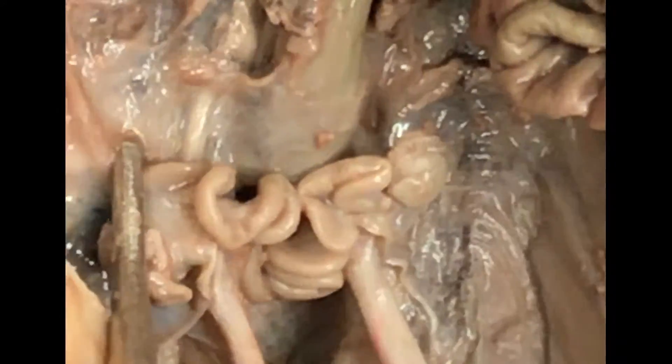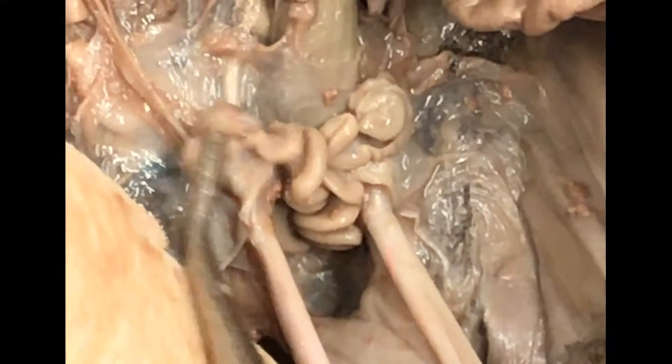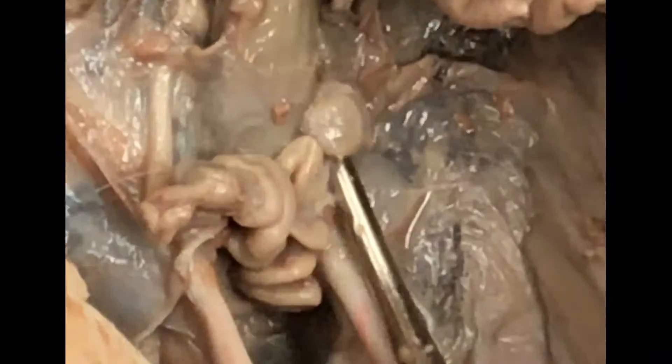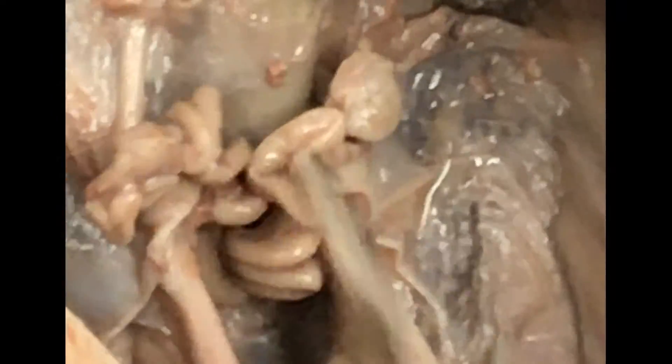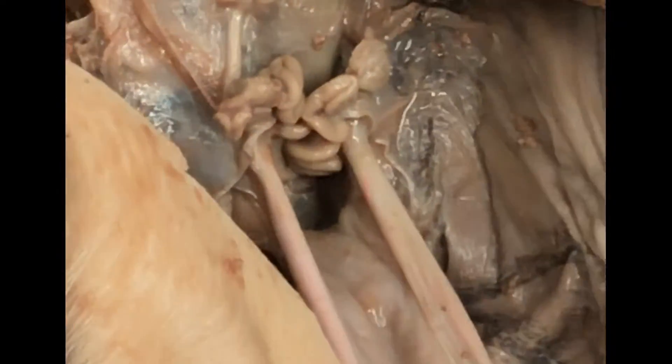I like uterine tube. These are the uterine tubes — my probe is pointing down into the uterus. And at the end of each uterine tube is this small little structure, smaller than a pea — that's an ovary. So you have ovaries, uterine tubes, and uterus, all behind the urinary bladder.